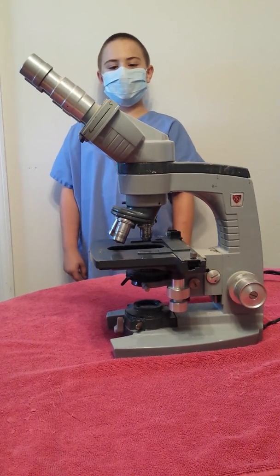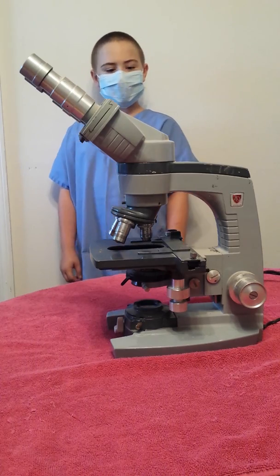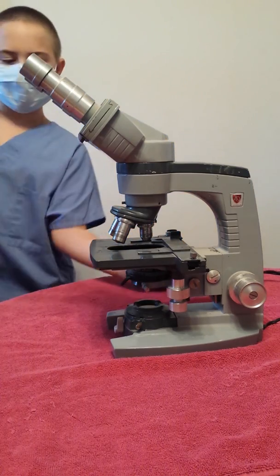Today we are going to be looking at a slide of a blood smear. So let's get started.